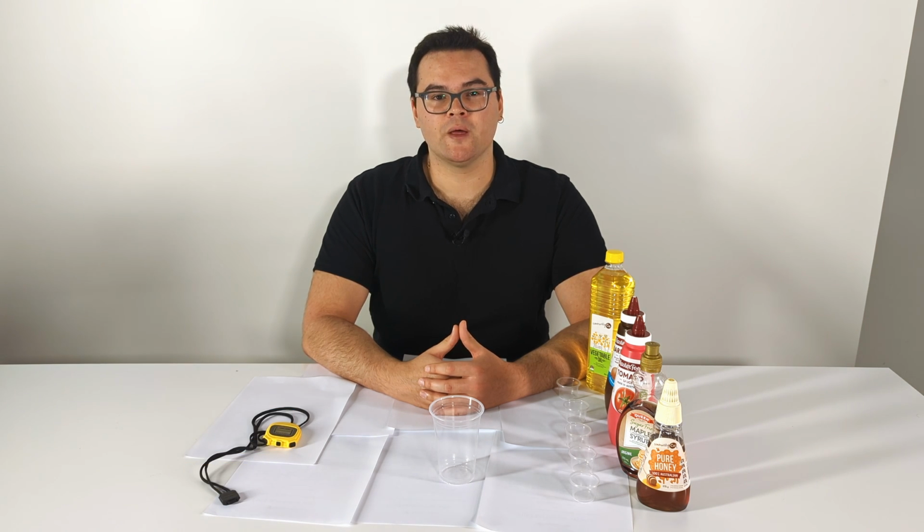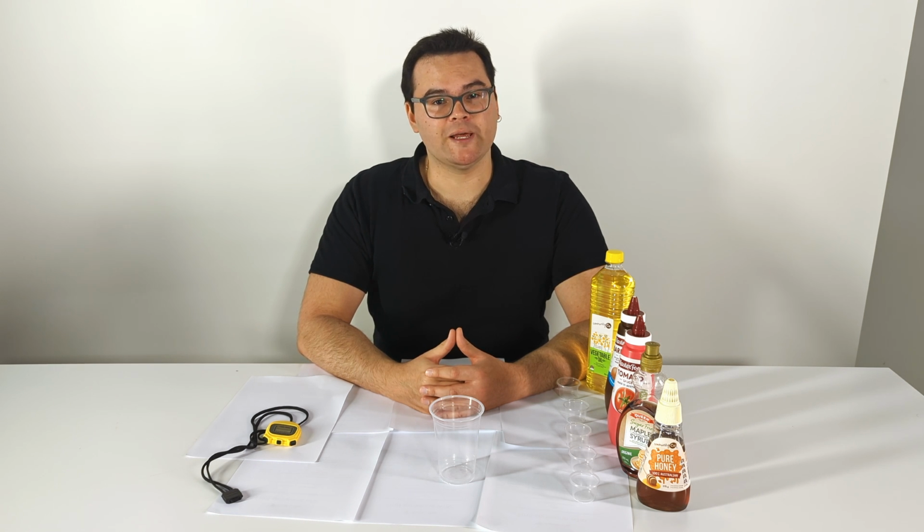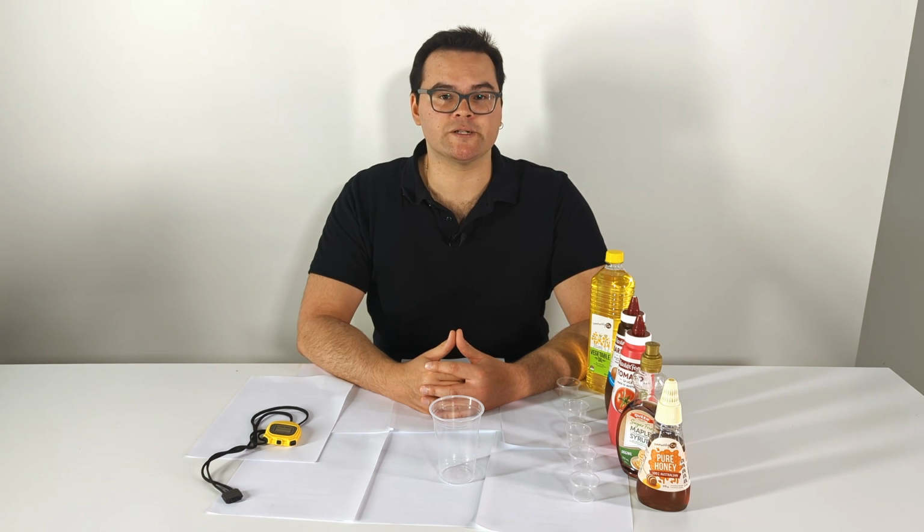In this video, I'll show you two investigation activities to explore the viscosity of a range of different liquids, and for students to use their knowledge about the size and shape of molecules and how they interact to explain why viscosity differs between liquids. Ensure that you have introduced the concepts related to viscosity with the whole class discussion described in the lesson plan.